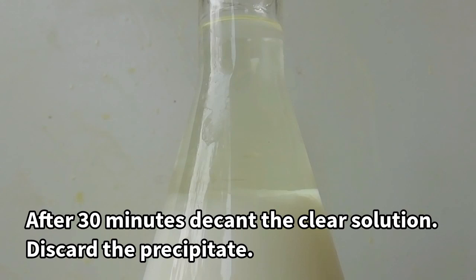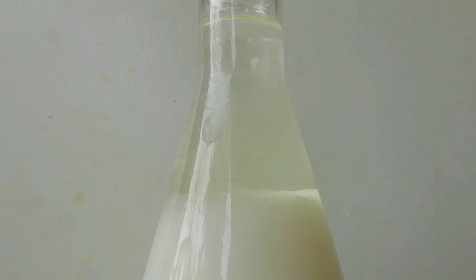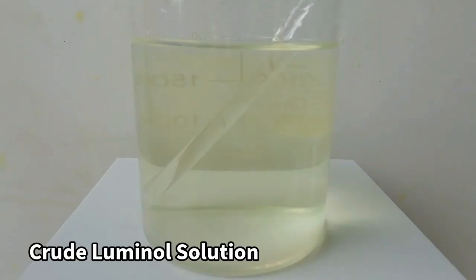After that by evaporating the solvent we can obtain the crude dry product. The amount of solid can be obtained is too low. Therefore I decided to keep the luminol solution.